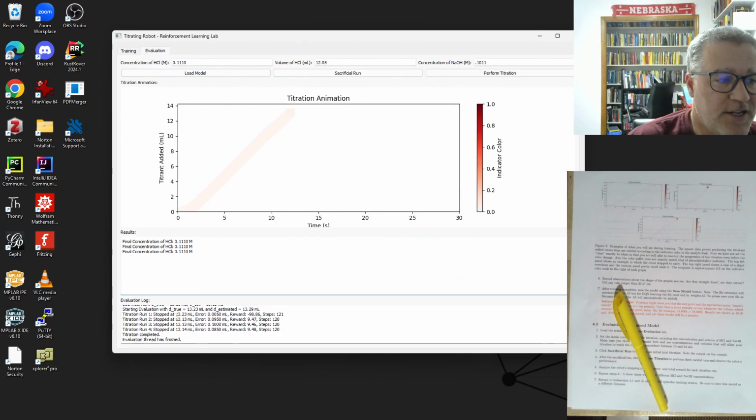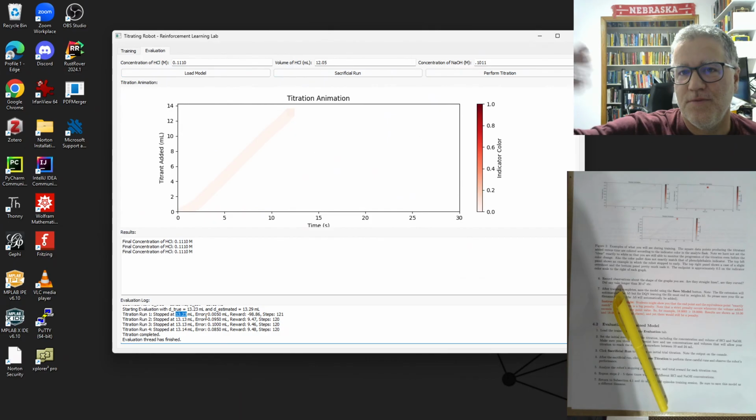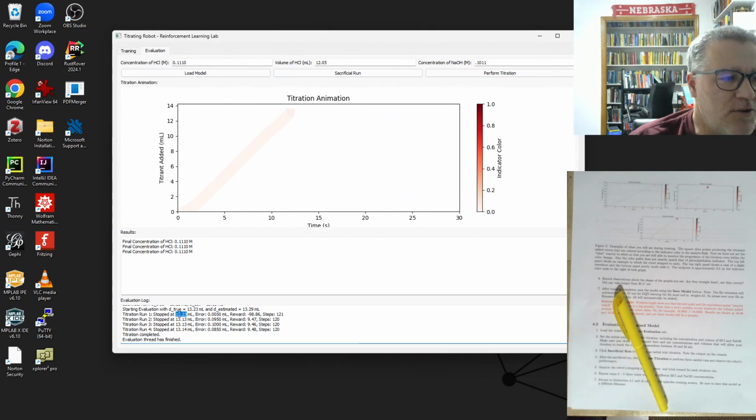pretty good. Look at in the first one, it actually missed by a little less. So this is interesting. The real answer is 13.23, and it got 13.23, but it looks like a little bit more, maybe like 13.235 or something. So there was an error here and it went past, and notice it did go past the value. Now the other values are actually rather poor here. So close, but not as good as we would like, and we can see we didn't quite get there with this color. So let's just try one more run here.